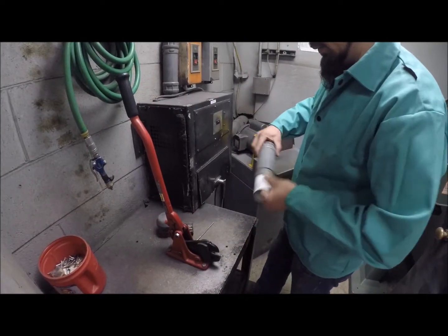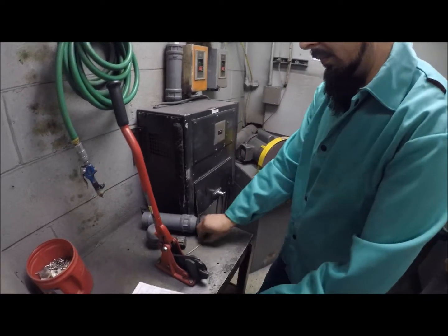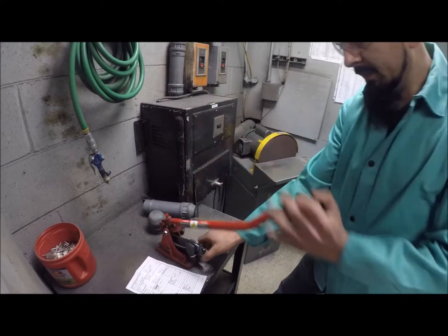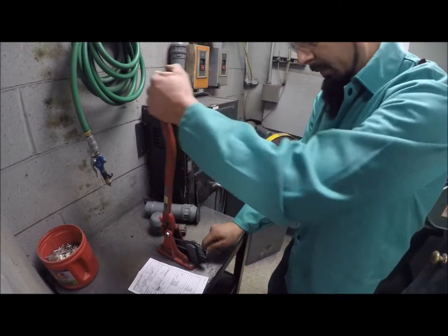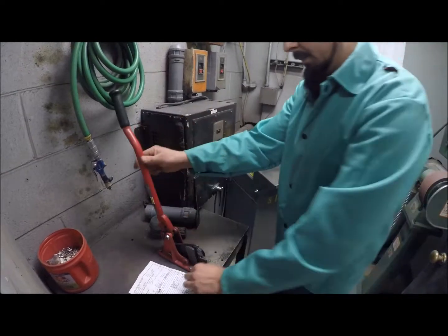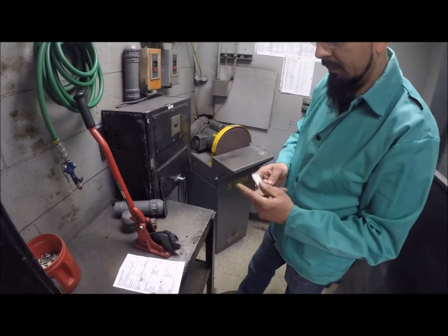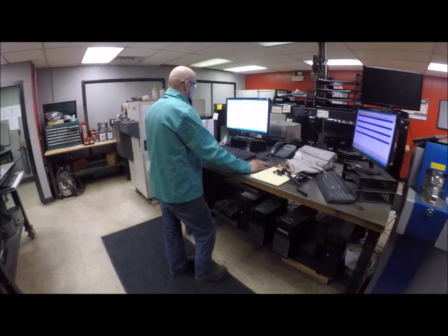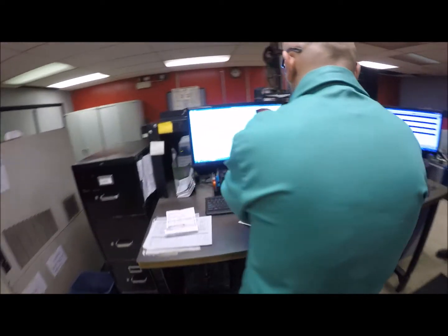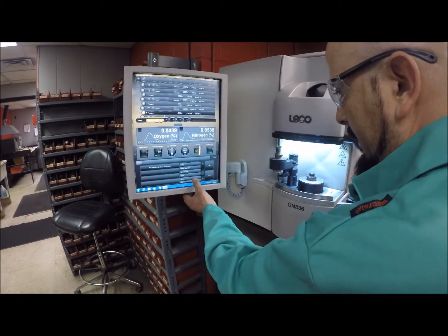We utilize state-of-the-art LECO determinators to attain superior accuracy when analyzing for the elements carbon, sulfur, and nitrogen. While traditional optical emission spectrographic methods are used by many facilities for the full chemical analysis, our LECO determinators provide more accurate and consistent results for these difficult-to-analyze elements. This accuracy provides one aspect of the process control needed to attain consistent casting quality as well as specification conformance for the many alloys we produce.